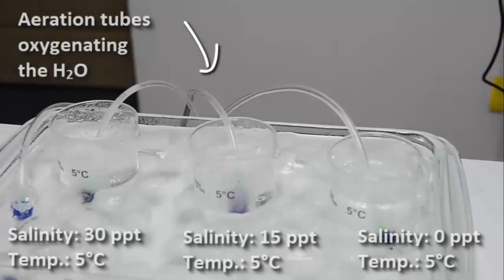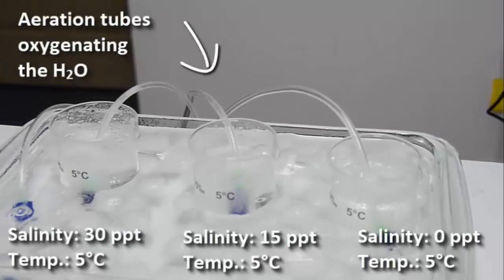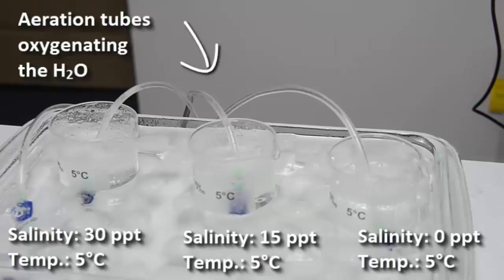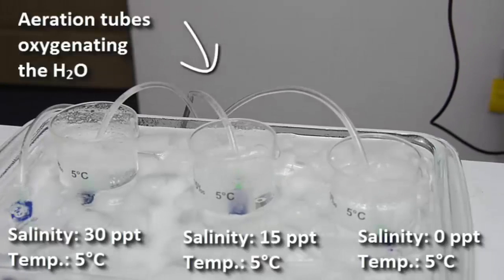So what we're going to do today is demonstrate that by looking at two different temperatures and three different salinities. As you can see here, I have one water bath that has ice water in it that is approximately four or five degrees centigrade. That's the cold water bath.